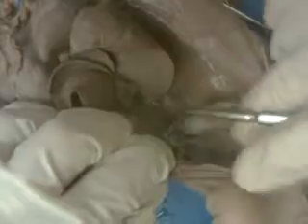Okay, the first branch coming off the aorta is the celiac trunk, and it ought to be like right here. Here it is, okay? There's the celiac trunk. Then the next one back should be the superior mesenteric artery.